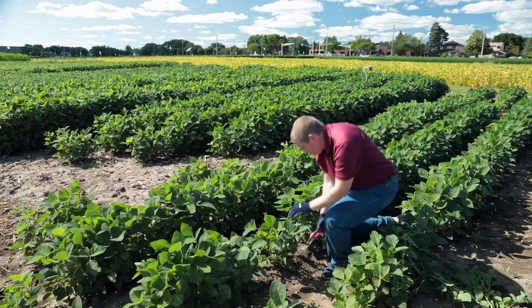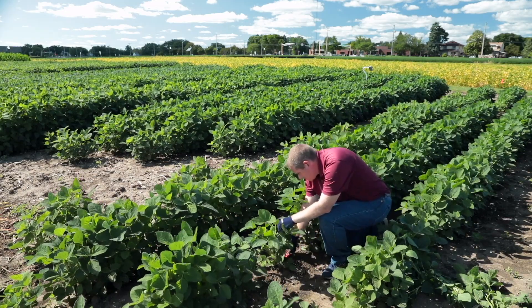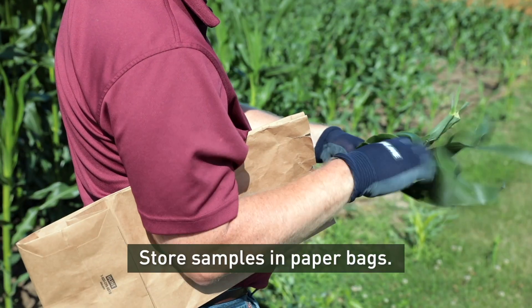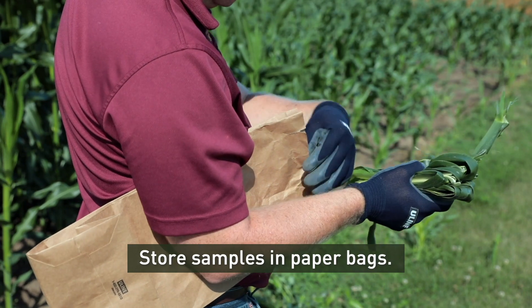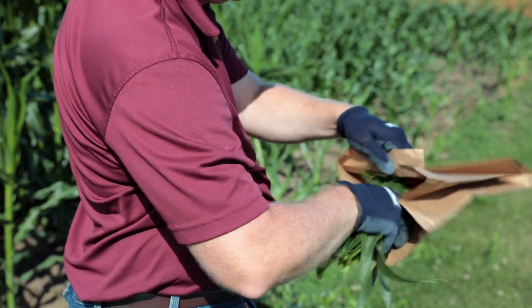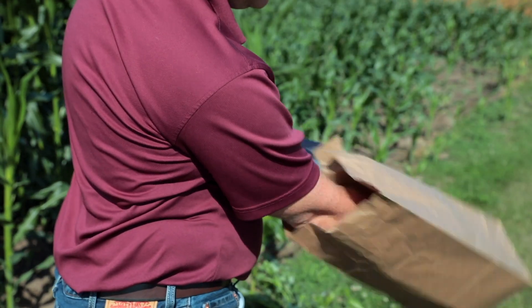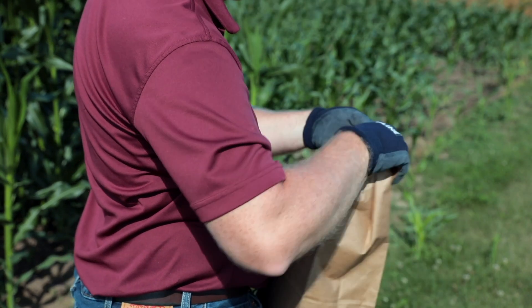Third, it's important to handle your samples properly. Paper bags allow your samples to dry, while plastic bags left in a hot vehicle will quickly deteriorate your samples to a point at which they're less useful for analysis.